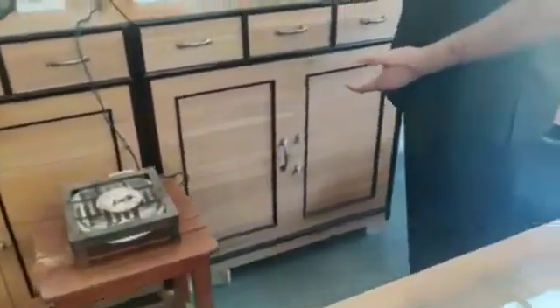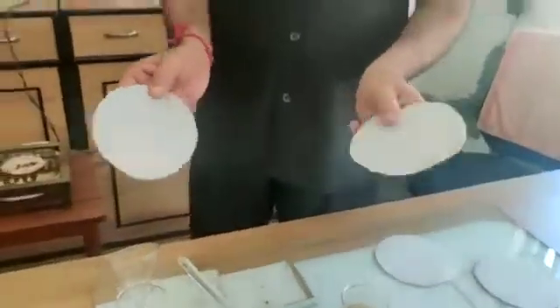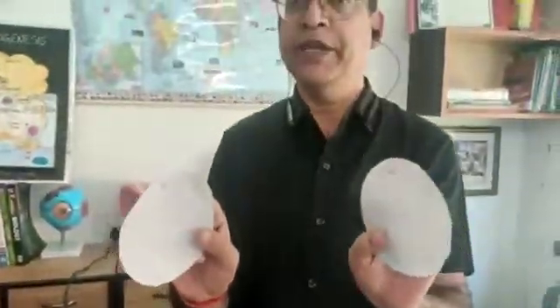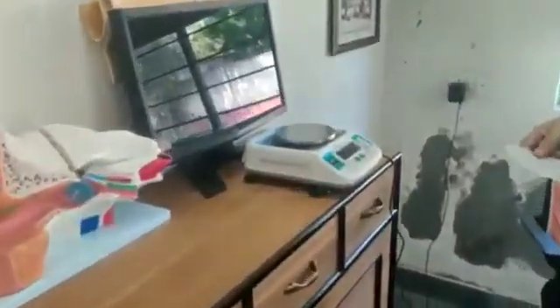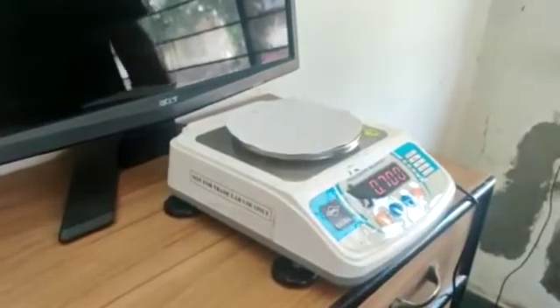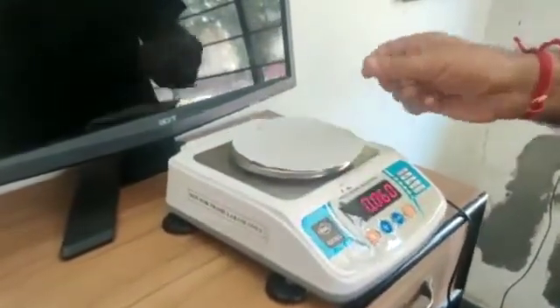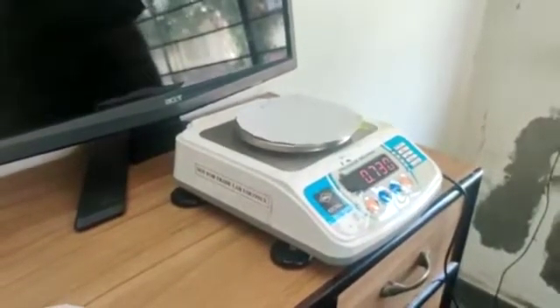We also have a balance and a heater. First of all, I will take the weight of the filter papers. One filter paper is marked A, another is marked B. This is our weighing balance. Filter paper A — you can note it down — its weight is 0.700 gram. Now filter paper B, its weight is 0.730 gram.